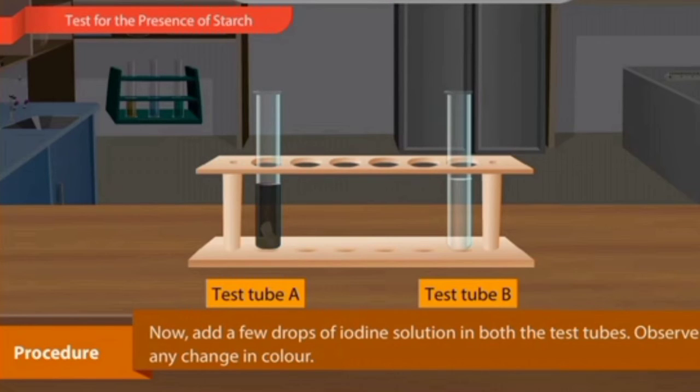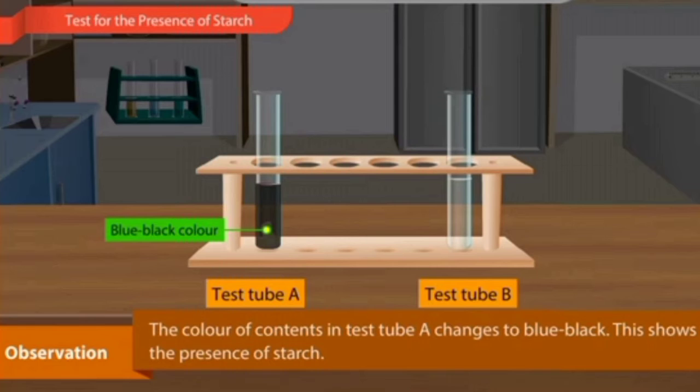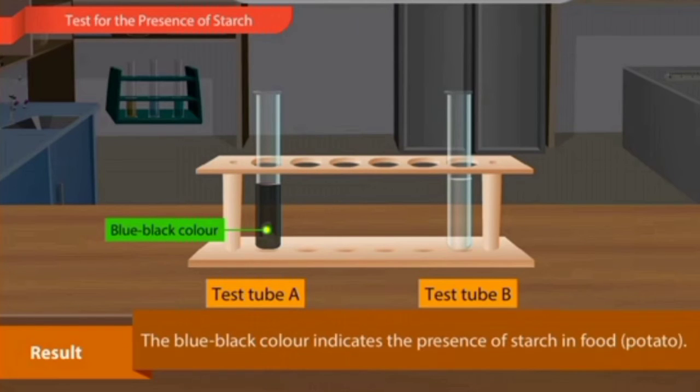Here you can see test tube A has changed to blue black color, and test tube B has not changed at all. The color of the contents in test tube A changes to blue black. This shows the presence of starch. So you can diagnose that starch is present, or you can say carbs, the carbohydrates. The blue black color indicates the presence of starch in the food. This is the result of our experiment.